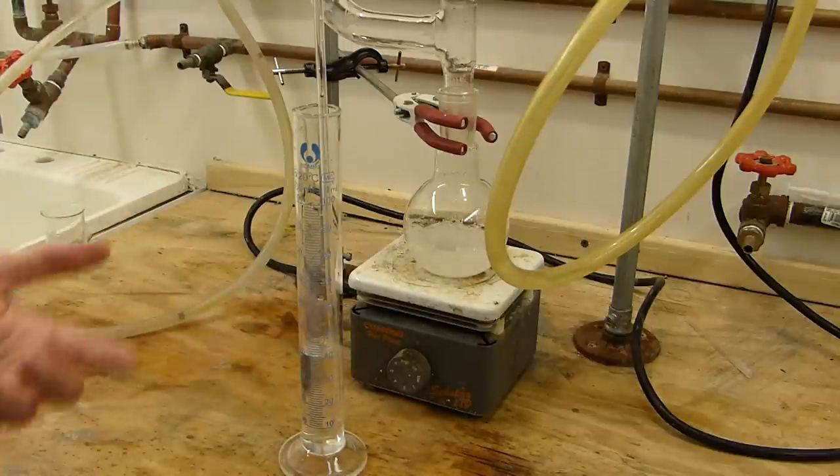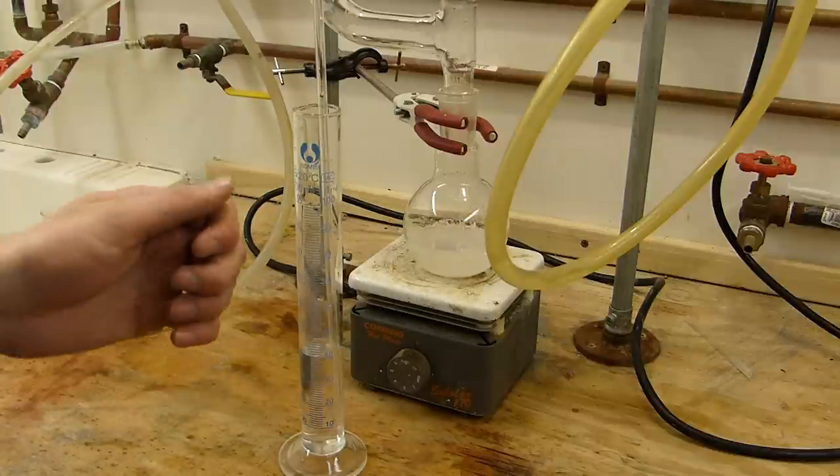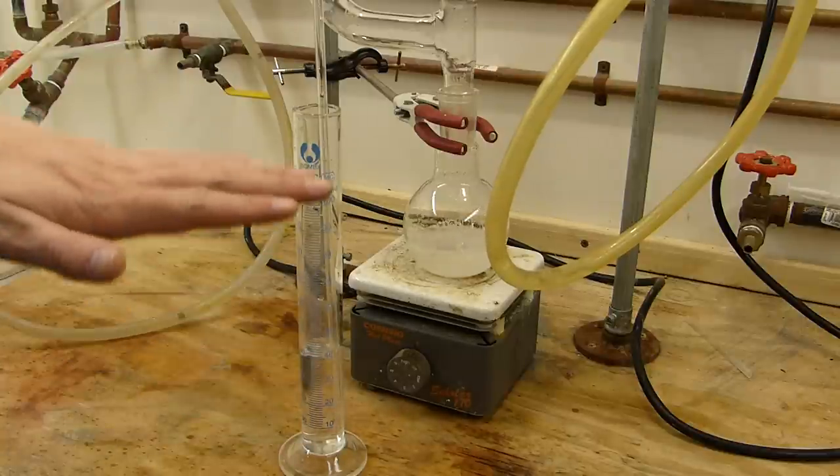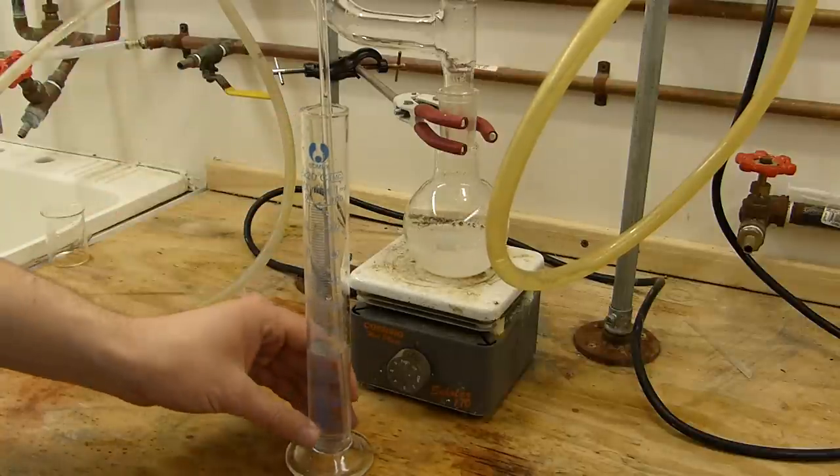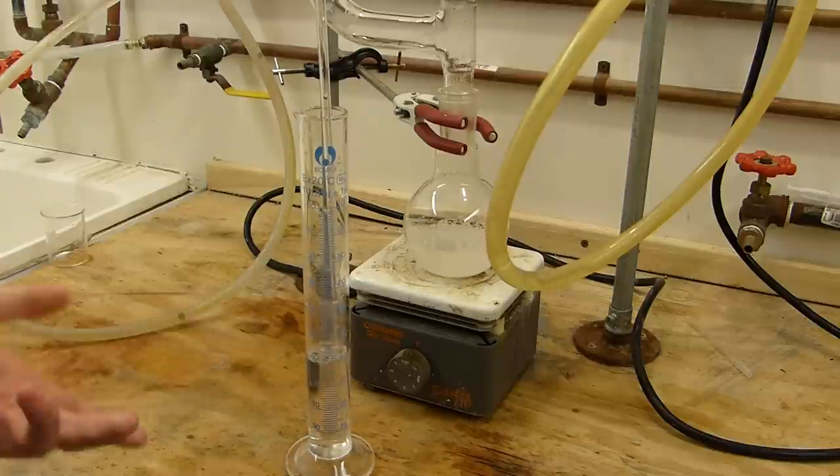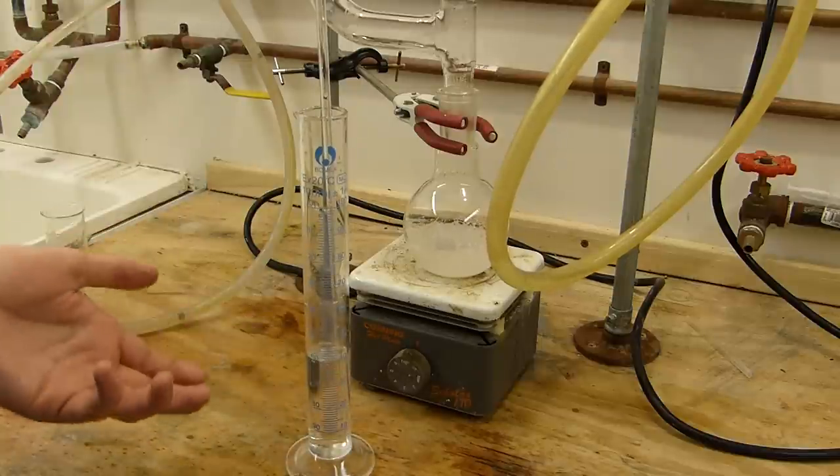In fact, you can demonstrate this if you have a test tube full of ammonia and you invert it into some water, you'll notice the water level will climb the test tube until it's completely filled and the ammonia is dissolved in water. It'll climb, for all intents and purposes, to the top.